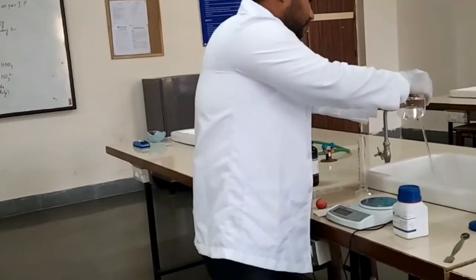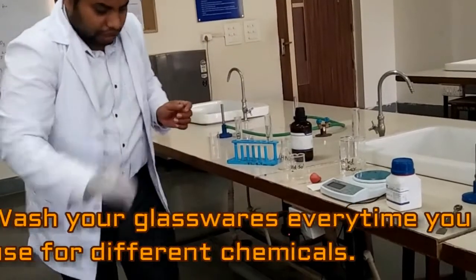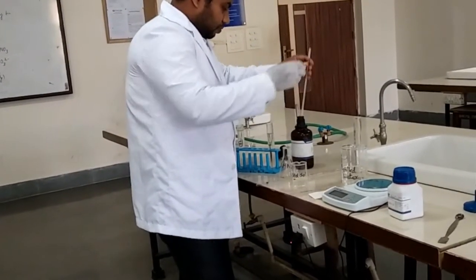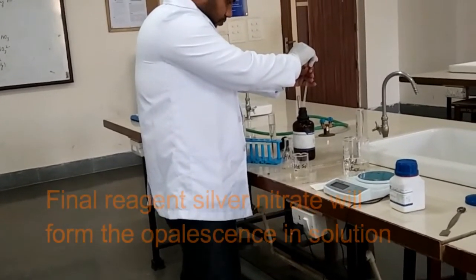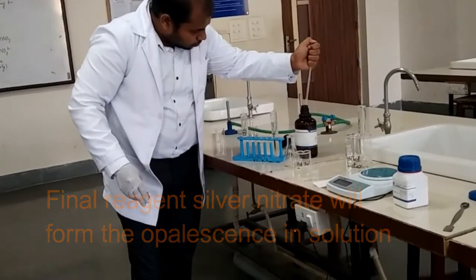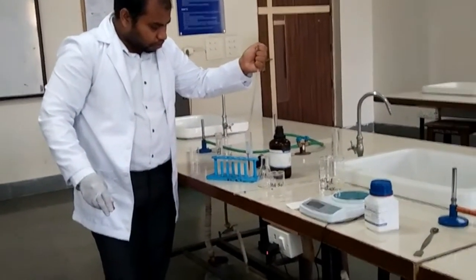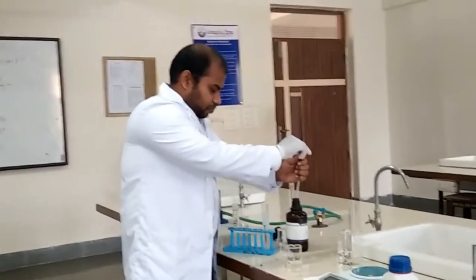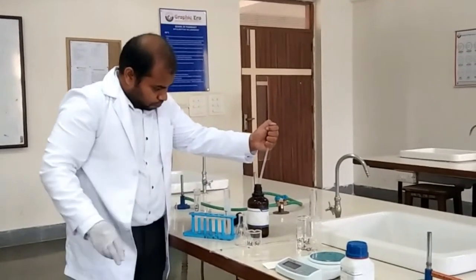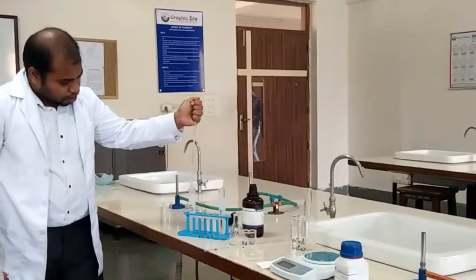We wash the pipette before using it for the silver nitrate solution. Using the rubber bulb, we transfer 1 mL of silver nitrate into the test solution, and then 1 mL of silver nitrate into the standard solution.